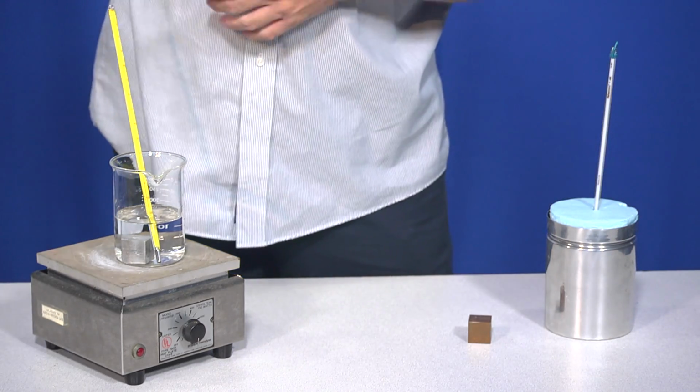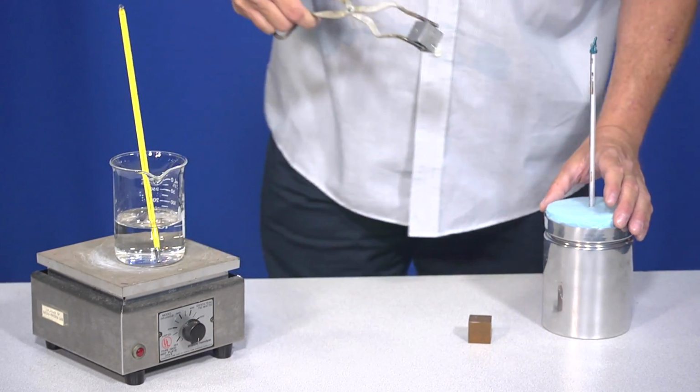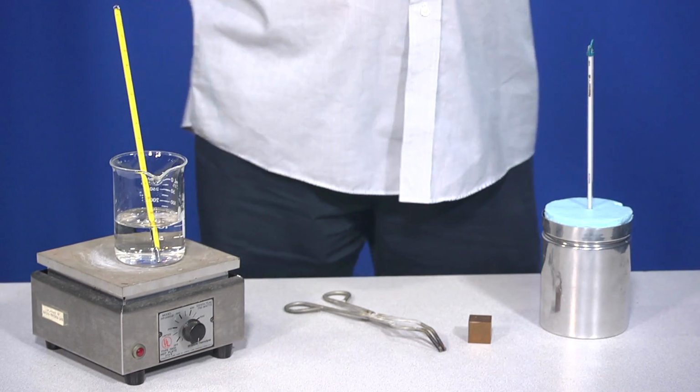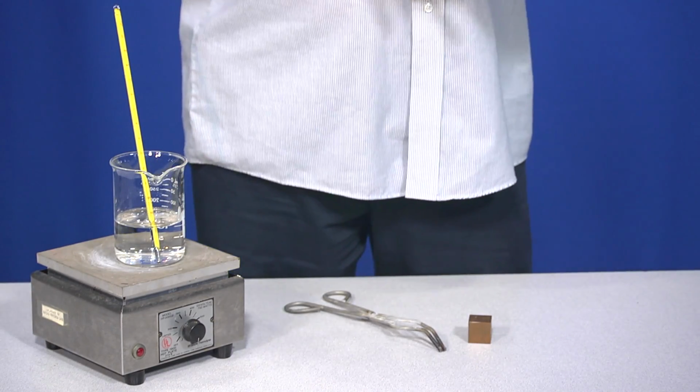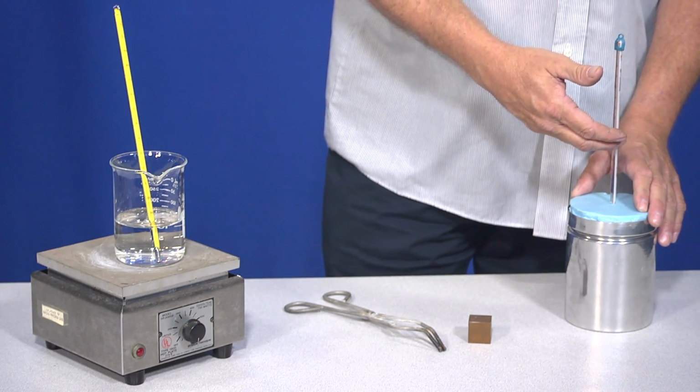We'll heat up the aluminum to boiling temperature, probably about 100 degrees C. And then you'll quickly place it in the cooler water in the calorimeter. So spontaneously, heat energy will flow from the hot sample into the cool water, and you'll stir and monitor the change as time goes by. The temperature will increase on the thermometer here, and it will reach a maximum eventually, and you want to record that maximum temperature. So given the initial temperature of the warm sample, and the initial and final temperature of your calorimeter, we can use energy conservation to determine the specific heat of the unknown sample.